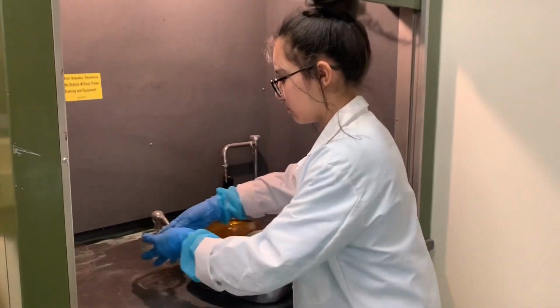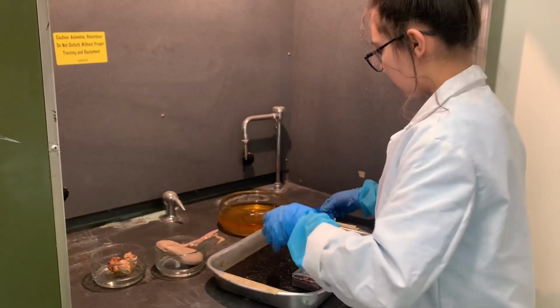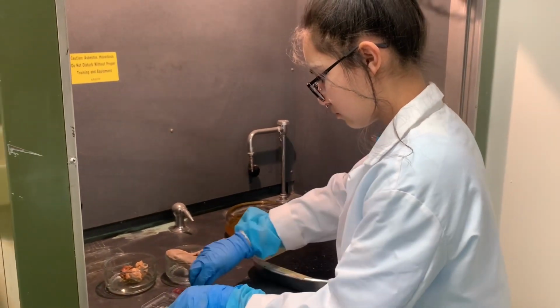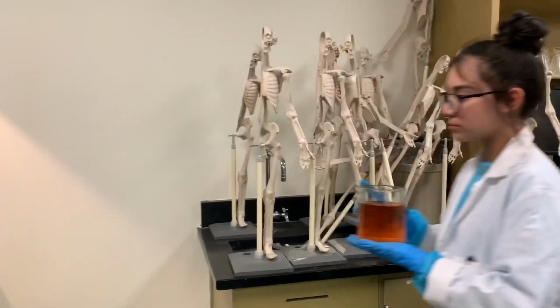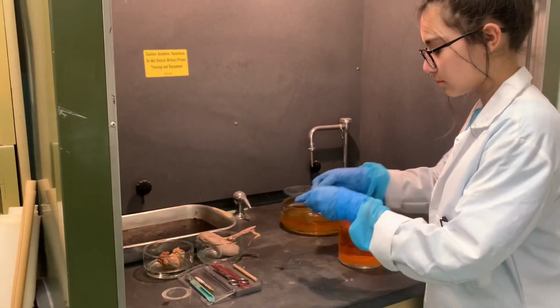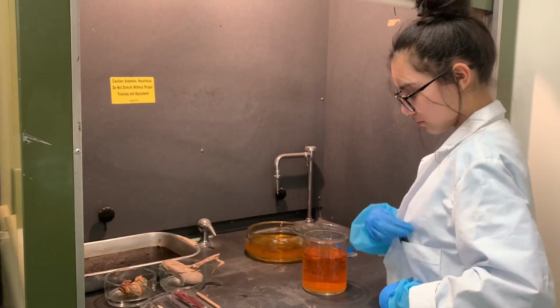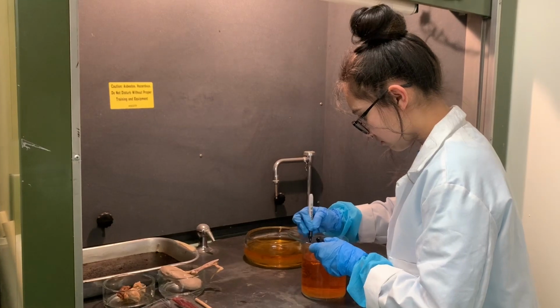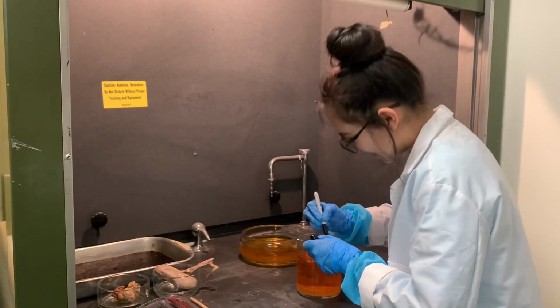Here I am setting up my working station, including the tools I will be using during the dissection, formalin, a dissection tray, and the specimen, which is a kidney in this particular instance. I start by setting a container of formalin, which is a fixative solution, under a fume hood since we are dealing with some pretty strong chemicals. I place the lid on the formalin container and label it with patient information, including the name and the date of birth of the patient.